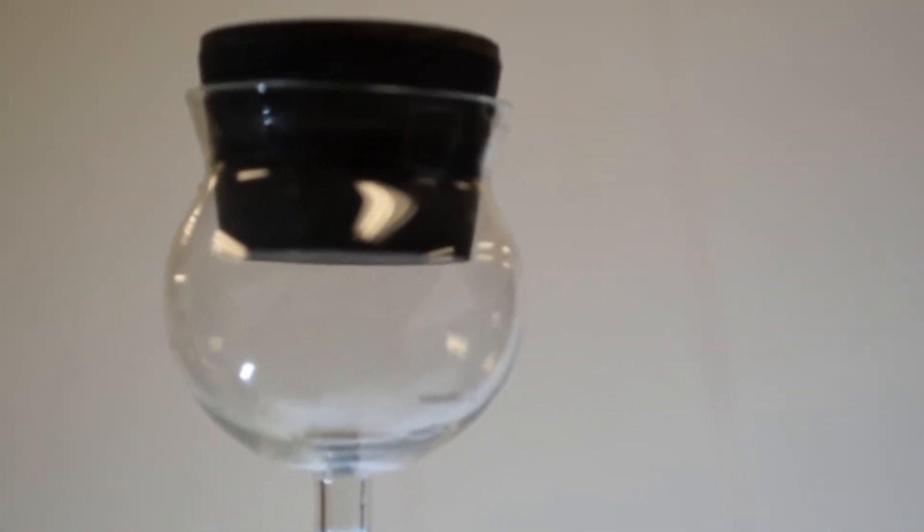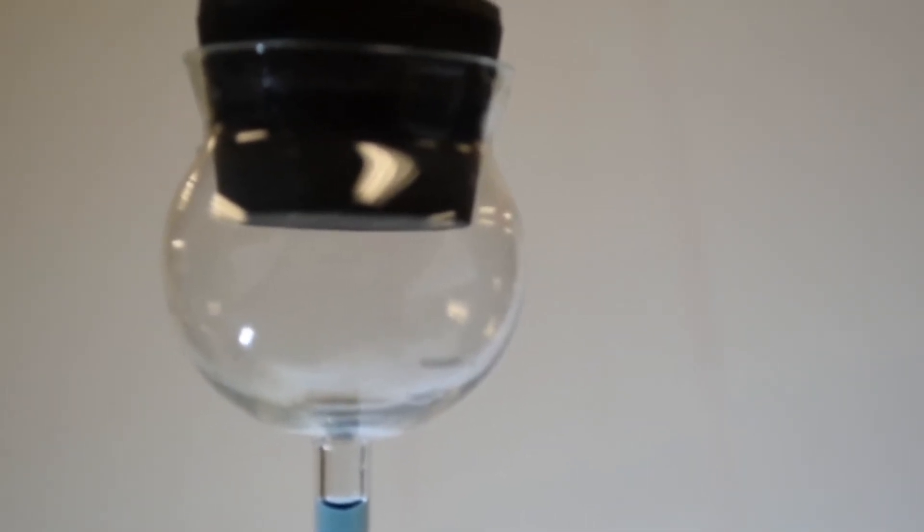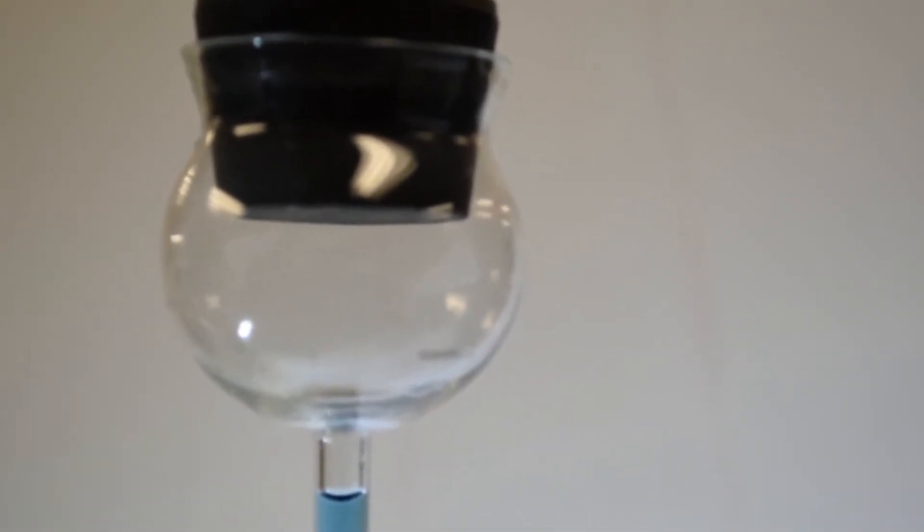And finally, once all the layers are in, place a stopper in the funnel and slowly withdraw it to avoid any mixing of the layers.